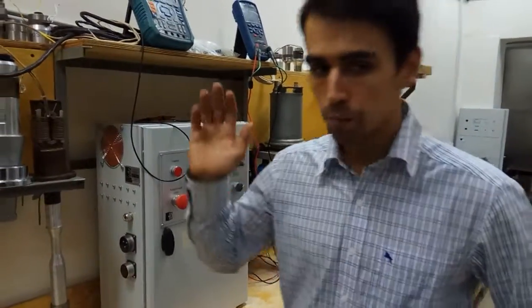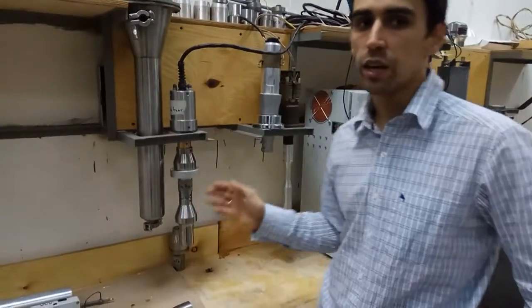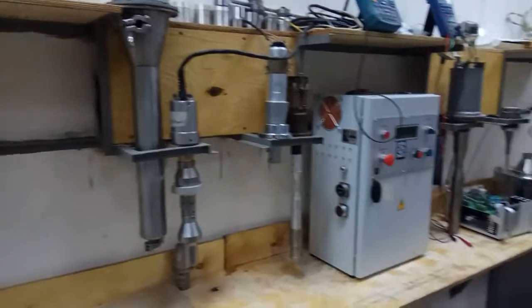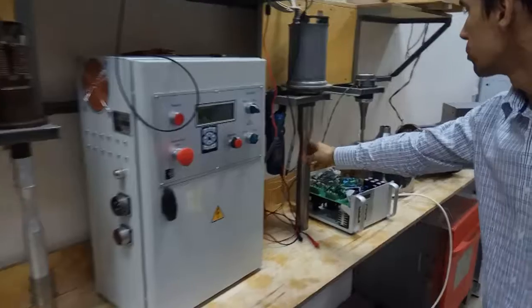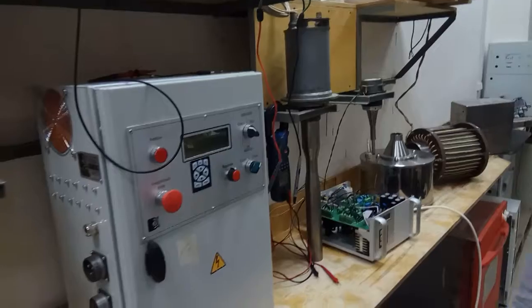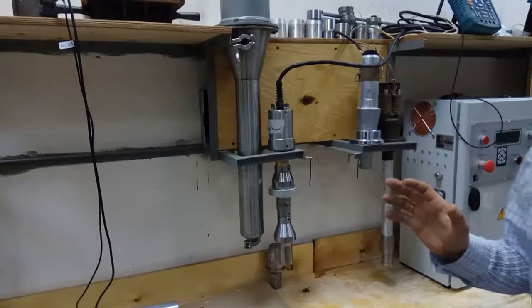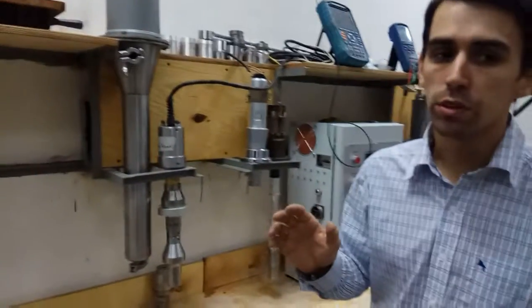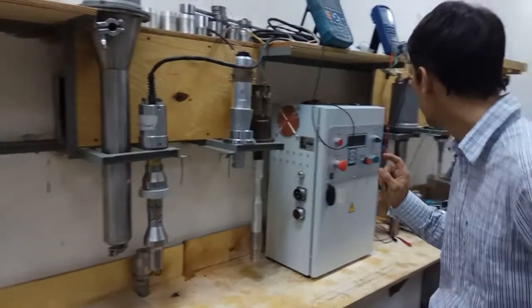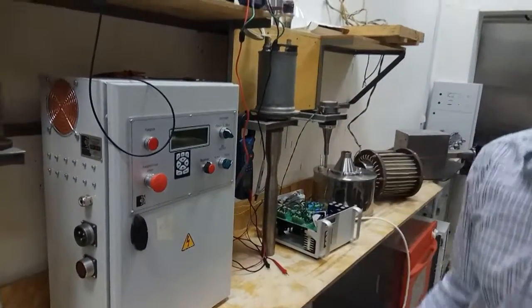Let's turn to the first type of flow-through ultrasonic reactors. These are high-amplitude reactors based on the emitting bar. This is the titanium bar. The principle of action is a punch effect. The feature of our equipment is the high amplitude of the working area of the instrument. At least 100 micron we can get on this tool.